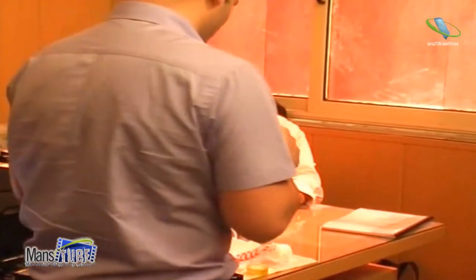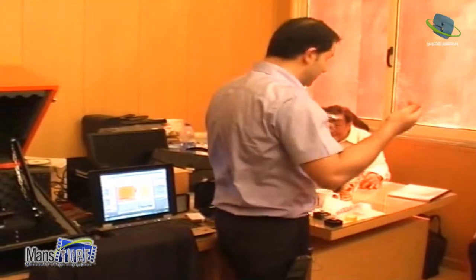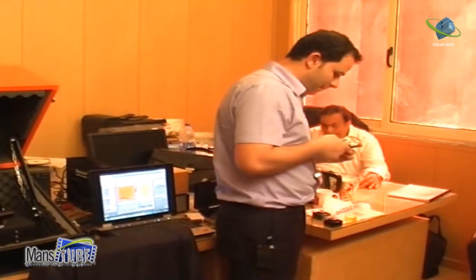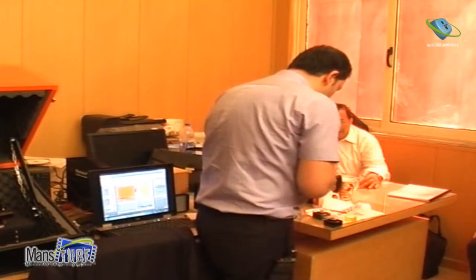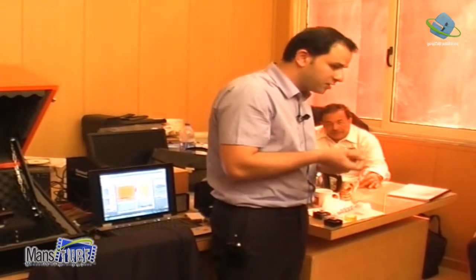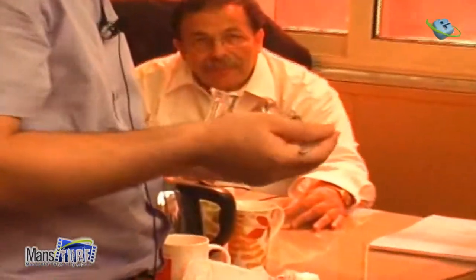Okay, so everyone has had this for a long time, but nobody studied that. Okay, so and then you can use also some kind of. So what we do now, I will take the sample. Let's say now there is nothing. This is just a substrate. Okay, there is nothing special. But if you have something, you can see. I will take maybe the HOPG. You can see better.